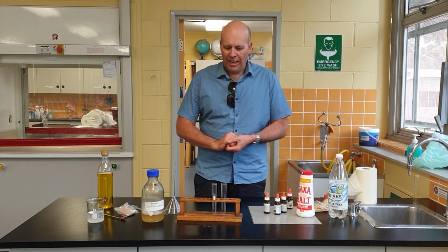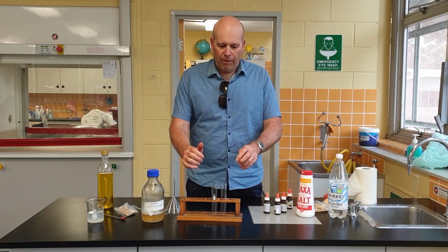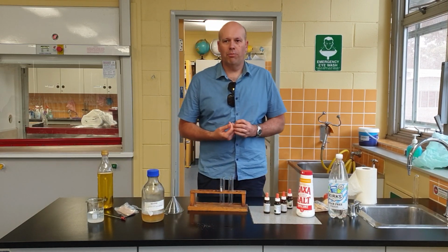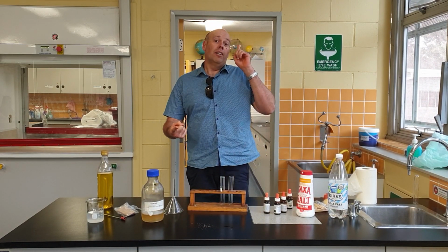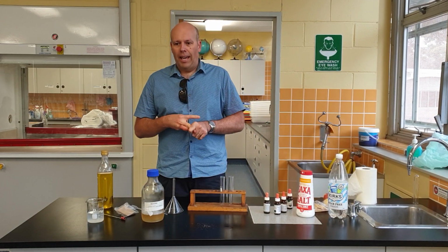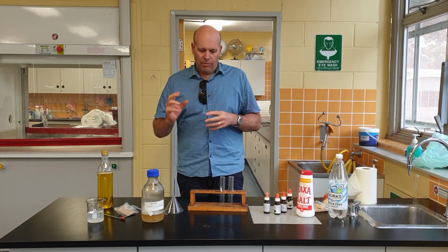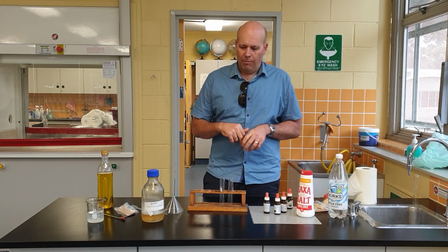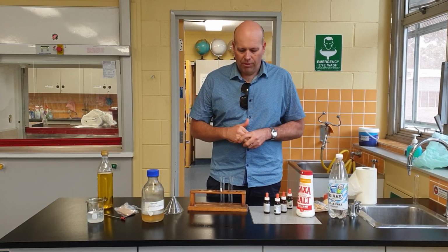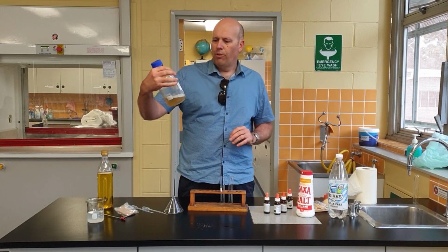All right, so hello Year 8. Welcome to a demonstration of the food chemical testing. As you know, in class we have already done the test for starch, and we've tested for glucose. Today I'm going to show you some further tests of how we can determine whether a particular chemical is in a food. So today I'm going to test for protein.